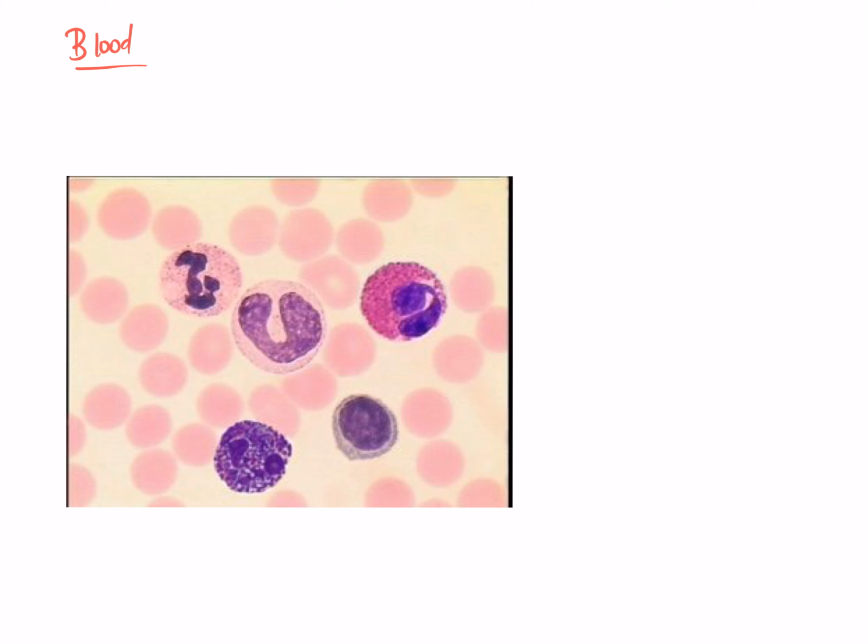Looking at blood histologically, obviously what you'll be looking in a blood smear is for cells, because everything else around it is plasma and water and it won't be staining up. So just to remind you guys, you did have an entire 1 hour review lecture on blood and hemopoiesis last semester. So go back to that lecture for more review slides if you do want that. So let's just quickly label the cells that are in here, and then over the next 2 slides we'll talk about their function and structure.